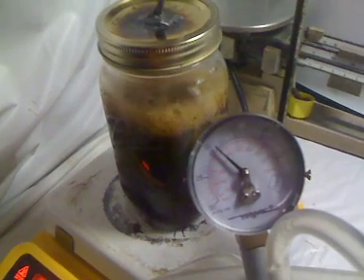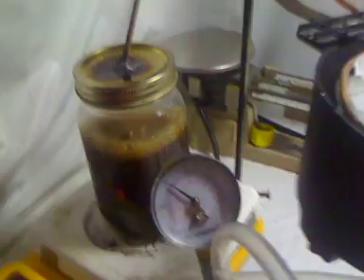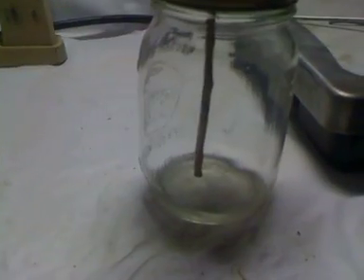At 20 inches of vacuum, boiling very rapidly. If we look over here at our catch container, we can see the methanol streaming in very fast with just 20 inches of vacuum.